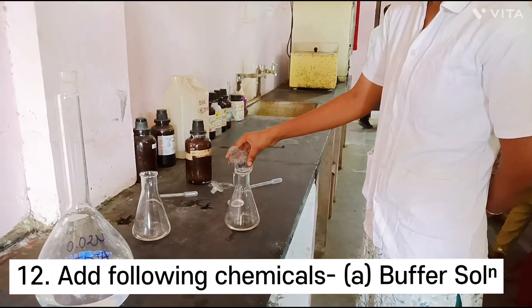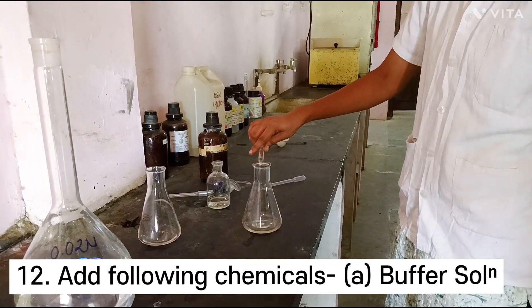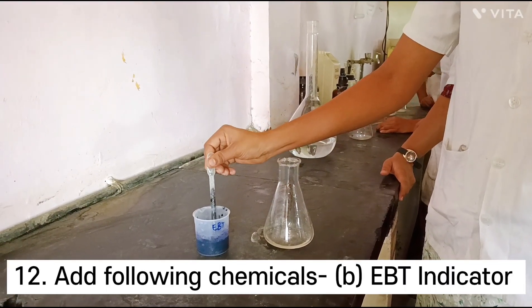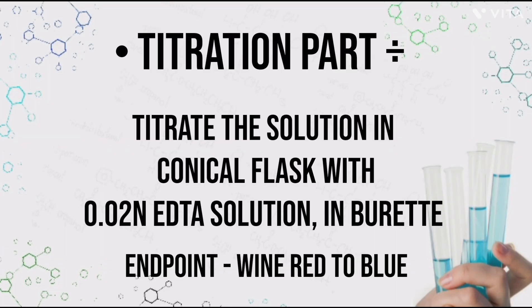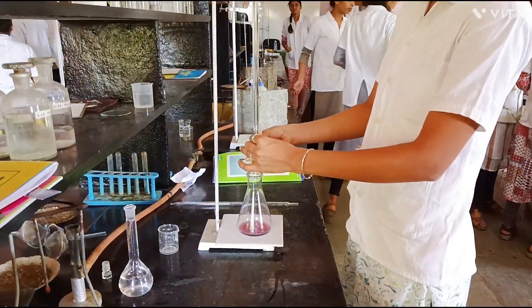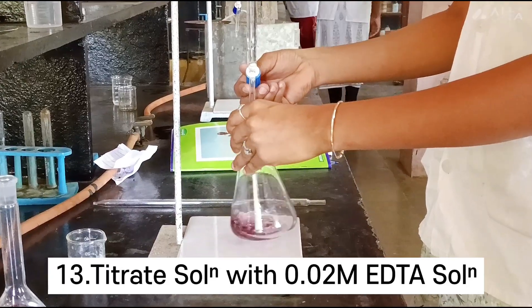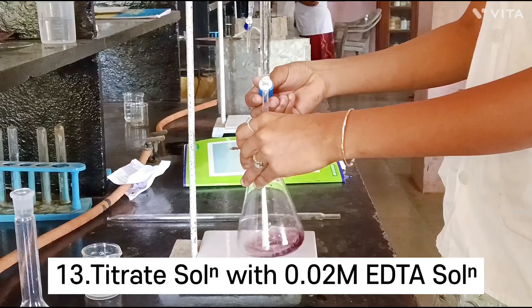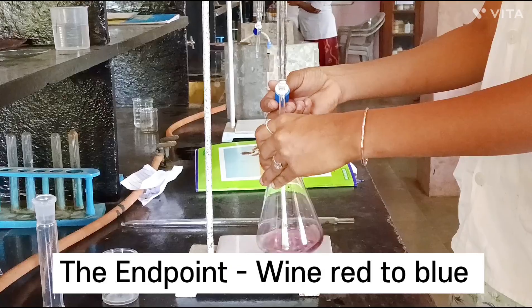Add 10 ml of buffer solution of pH 10 and 2-3 drops of EBT indicator. After addition of the indicator, the color of the solution becomes wine red. Titrate the solution with 0.02 molar EDTA solution until the color becomes blue. The end point of the titration is wine red to blue.